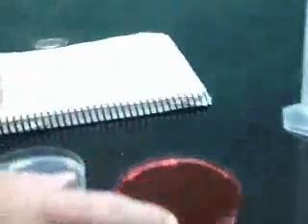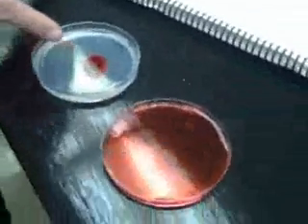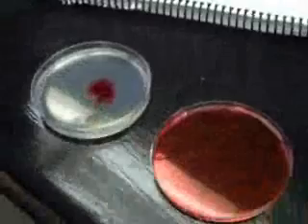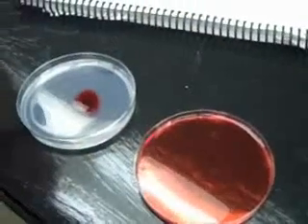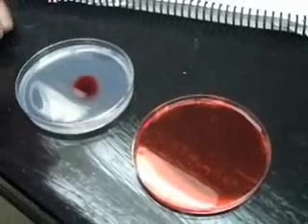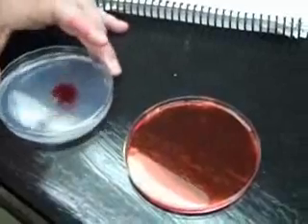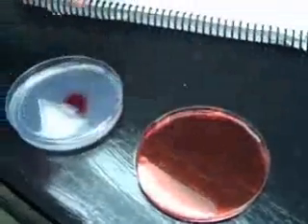We've got some plates here to demonstrate that. I've got a plate of water, which is low viscosity, and a plate of agar, which is very high viscosity — agar is like a jelly and doesn't flow. I've put a drop of red food coloring in each one. You can see that in the water, all the red food coloring has diffused throughout, while in the agar it has diffused only a very small amount, because agar is too viscous for it to diffuse easily.